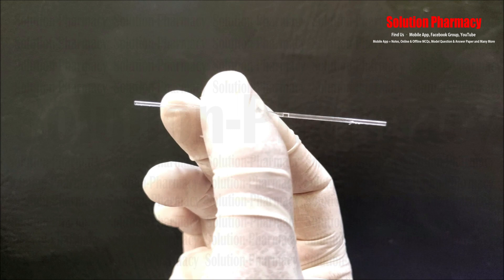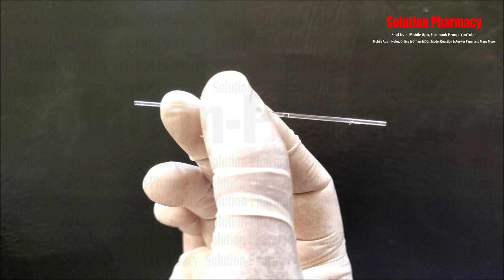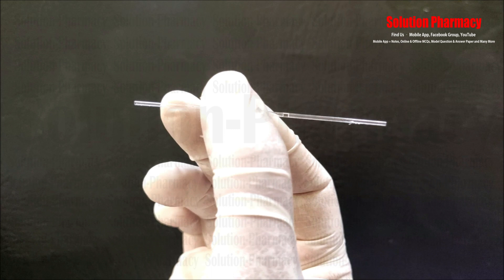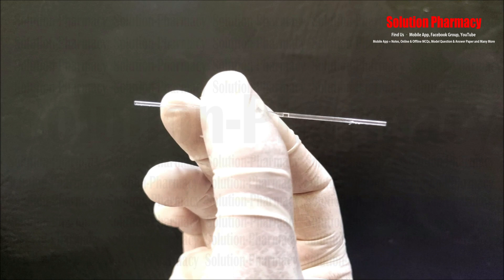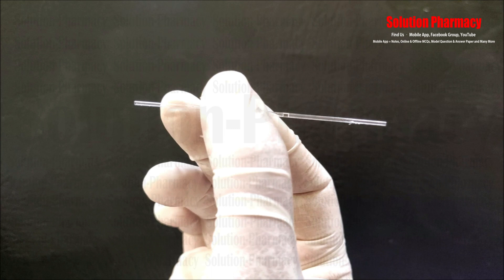This capillary tube is used to collect liquid samples, which flow up into it by capillary action. It is commonly used in medical and research fields to draw very small liquid samples such as blood or chemical samples for analysis. In chemistry labs, it is used for spotting the TLC plate — placing very small amounts of sample and standard solution — and similarly in paper chromatography. It is also used with one end sealed to fill a sample for melting point determination.